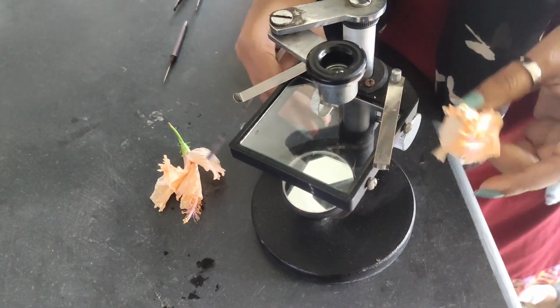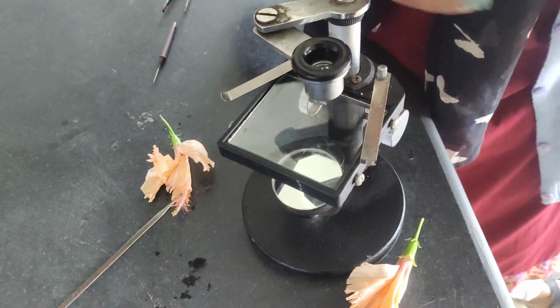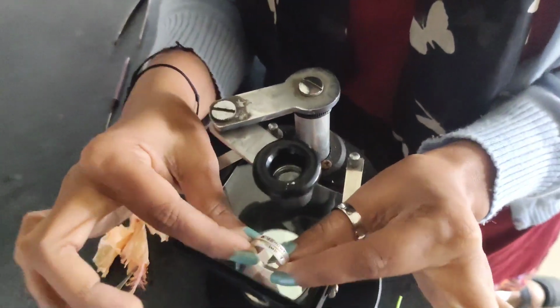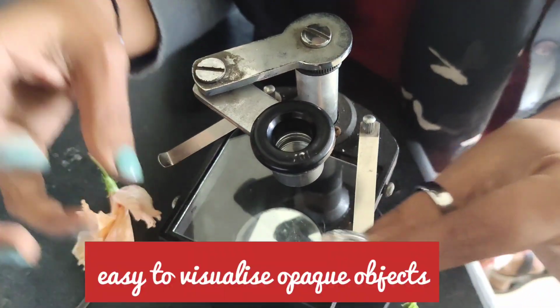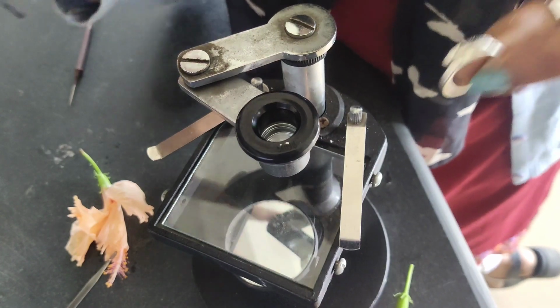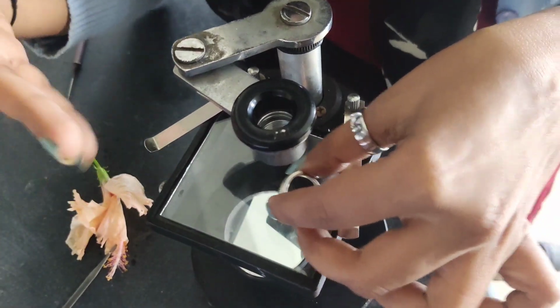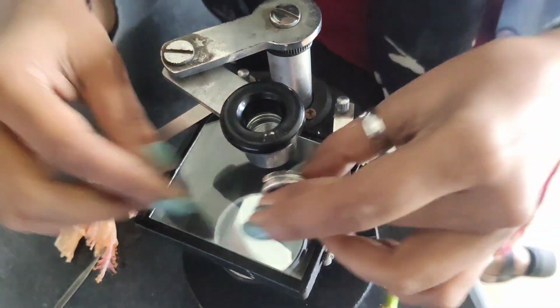Another important thing is that this can give you a three-dimensional view. I'll show you something very easy that the objects you can see here is you cannot see this ring in a compound microscope because this is gonna make it opaque. You can watch any kind of like flowers, maybe a rock or maybe coins as well. So these are the opaque objects. So the light is not passing through them. So that's the easiest path to see it. It works similar to the magnifying glass as well.